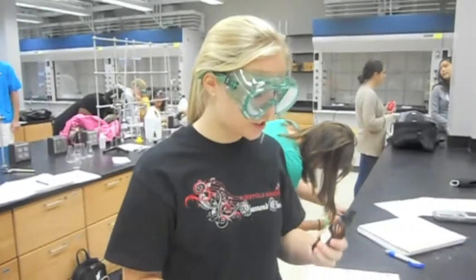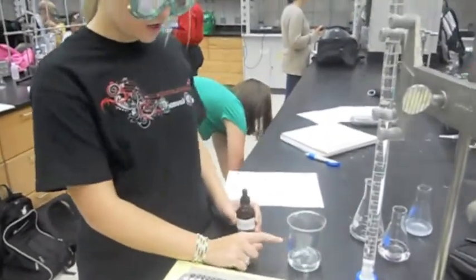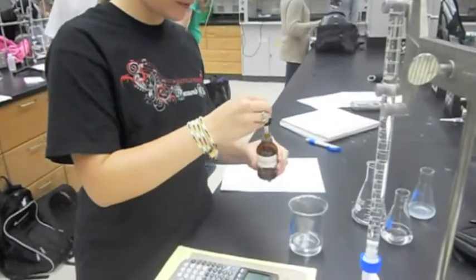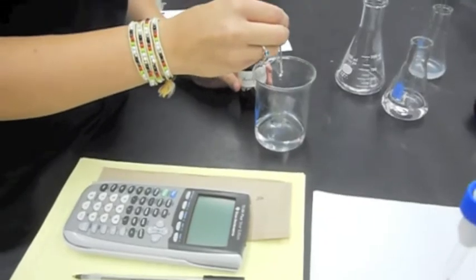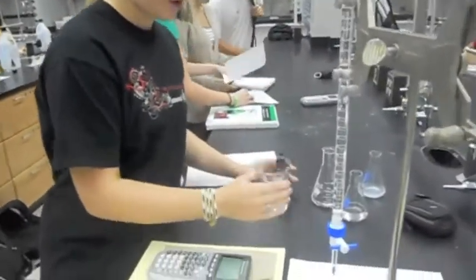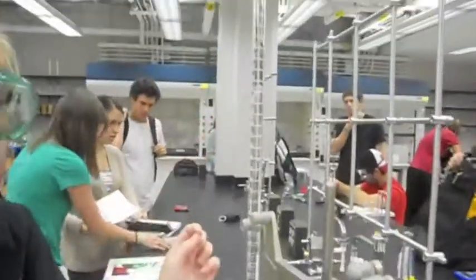During a titration, it's sometimes necessary to put an indicator solution in our KHP. We're using phenolphthalein, and we're going to put a few drops into the KHP, about 3 drops. Then we're going to put this under the burette. When using a burette, it's very important to rinse it 3 times with water and then 3 times with the solution. In this, we're using NaOH.